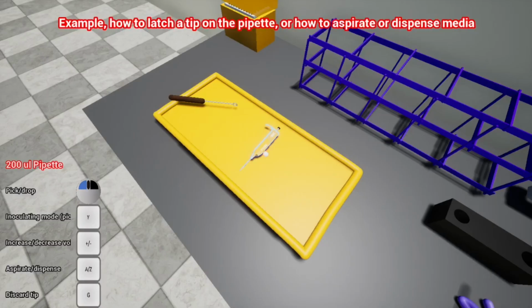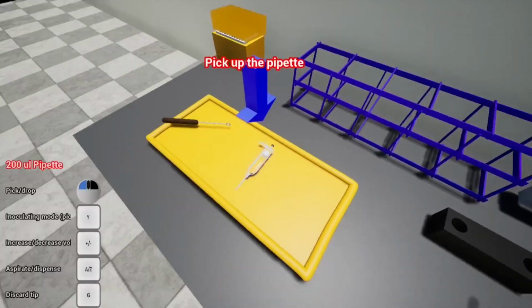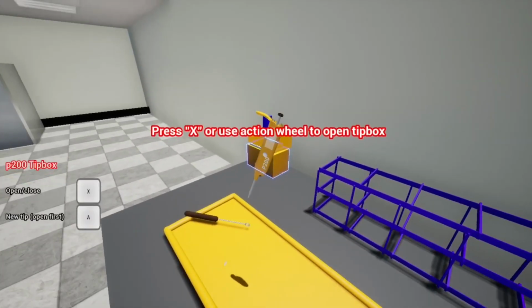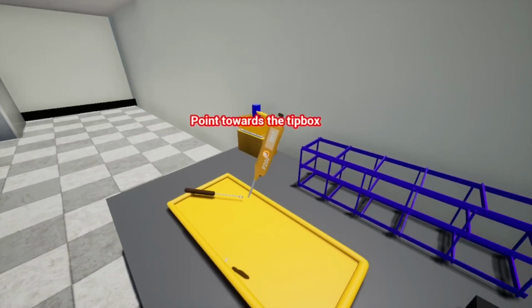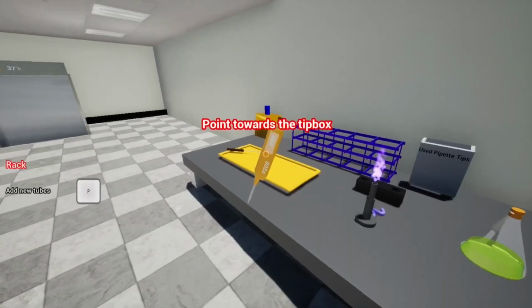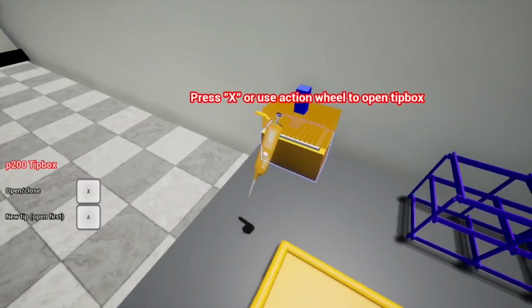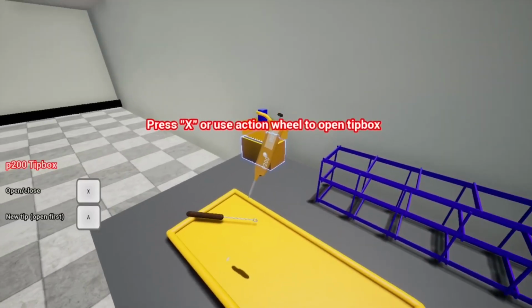Now let's learn how to interact one object with another. Example, how to latch a tip on the pipette, or how to aspirate or dispense media. Let's try this. Now pick up the pipette. Point towards the tip box. Use the action wheel to open the tip box. Sometimes it says to point towards the tip box, but you might be a little bit further away, so you might go a bit closer, but don't go too close, otherwise you might miss. But as soon as it highlights, you're good.